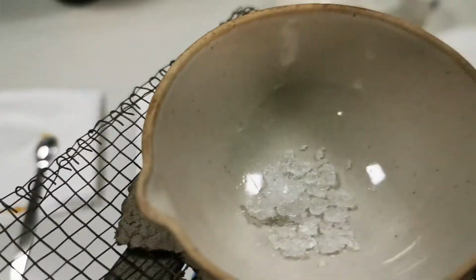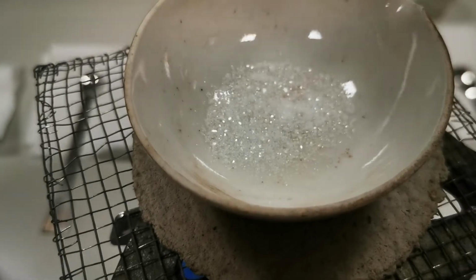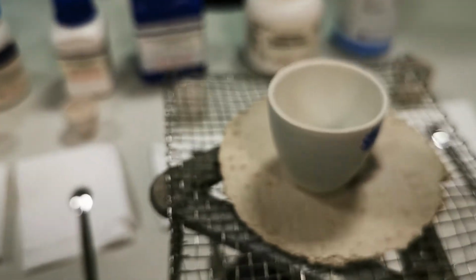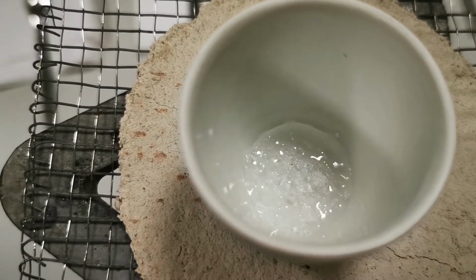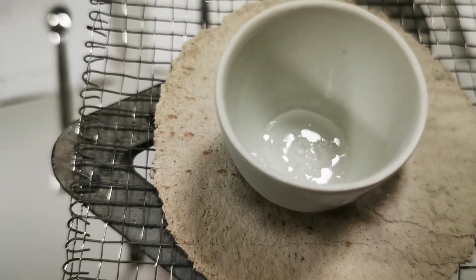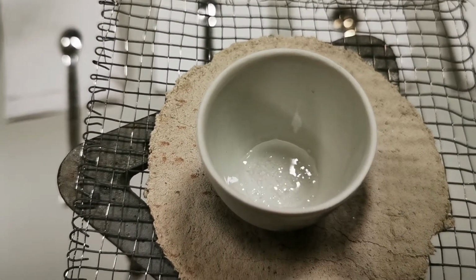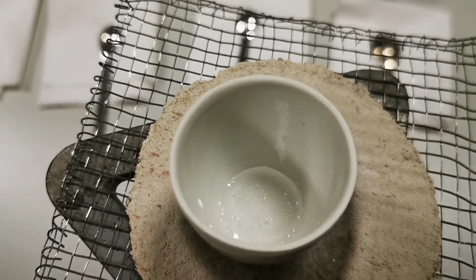Now I'm going to show you other hydrates that I am heating. So over here I have the barium chloride X hydrate. I'm heating it, and over here I have the calcium nitrate X hydrate. This is very fast. You can see very well the water started to evaporate from the hydrate. We just have to wait some time until all the molecules evaporate in order to measure the mass again.